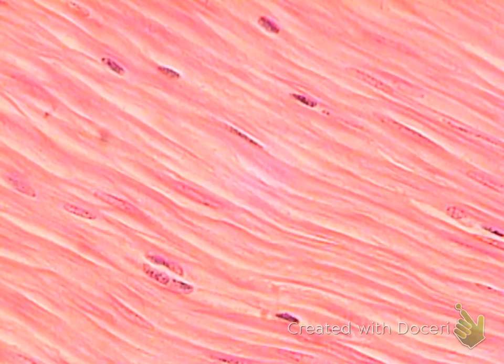In this tissue, it is kind of hard to see the shape of the cell, but it is spindle shaped. Notice that the nuclei are distinct, even though you can't see a lot of them. They are centrally located and they are single nuclei per myocyte, and there are no striations. Therefore, this is your smooth muscle tissue, and that's where it gets named. Notice how the tissue looks like a flow of smooth, almost like water flowing. That's why it's named smooth muscle tissue.